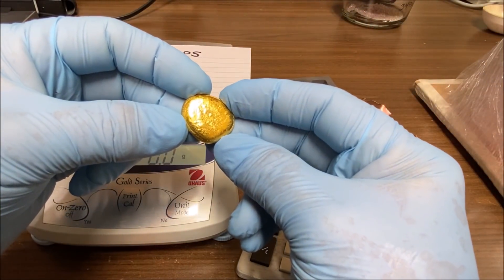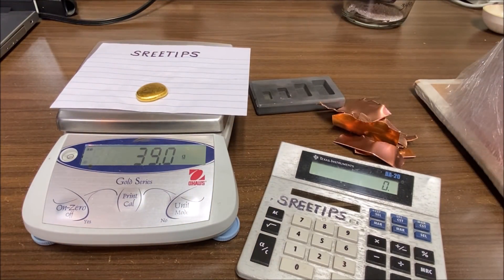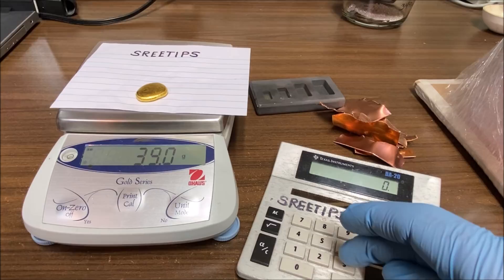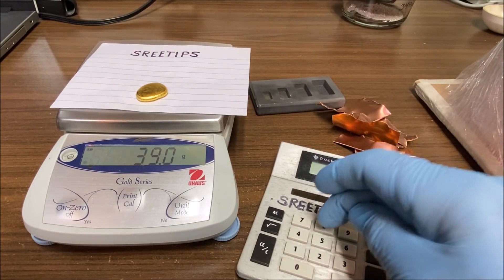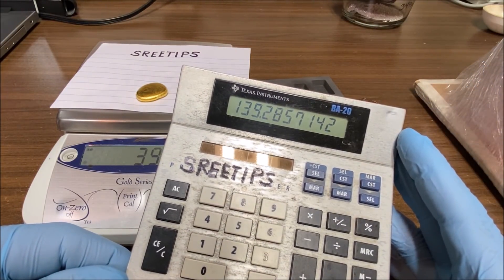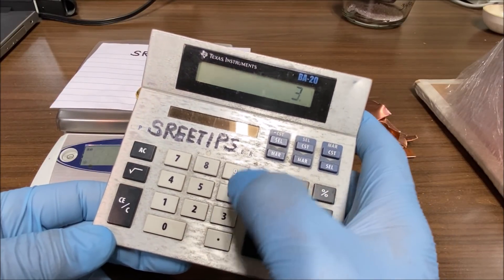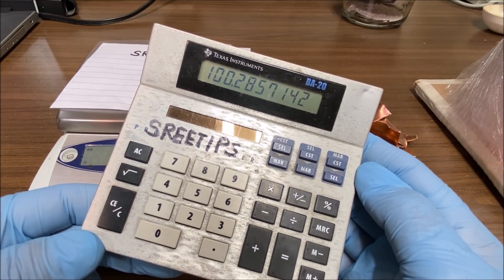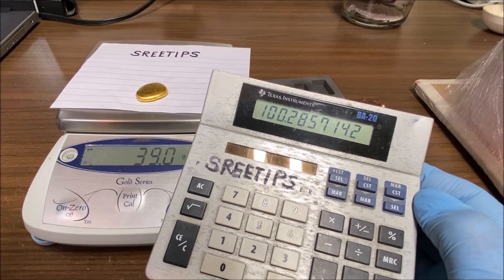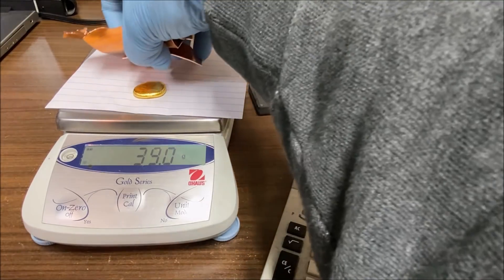Here's the gold button from the jeweler's high-grade drawer sweeps. We're going to put it on the scale — you can see it's 39 grams. We want an alloy that's 28% gold, so I take 39 divided by 0.28 and we'll end up with 139 grams of metal once we're done with the alloy. We subtract 39, and that's how much copper we want to add.